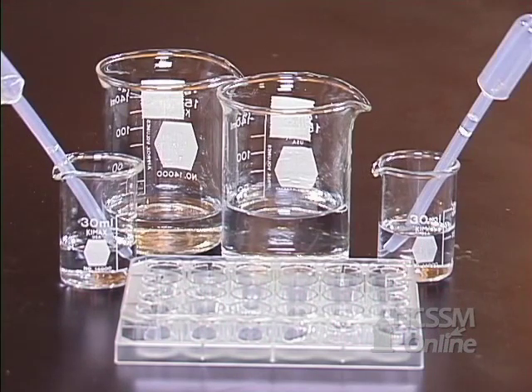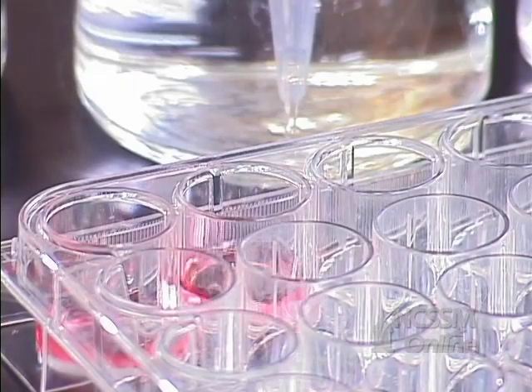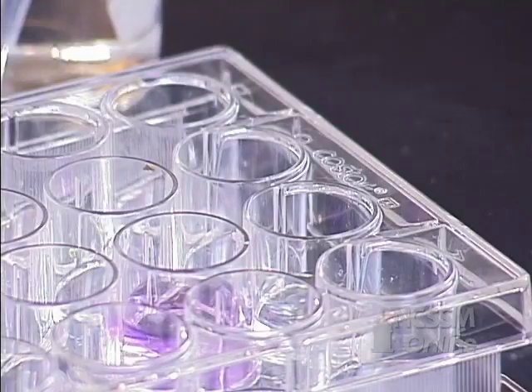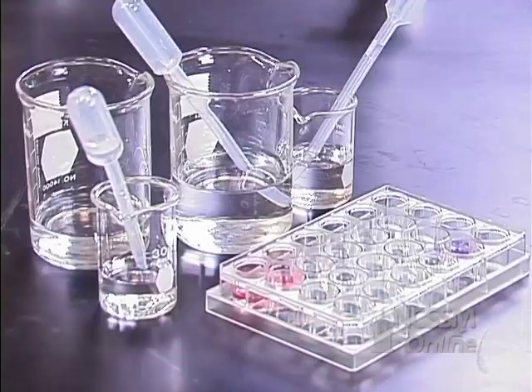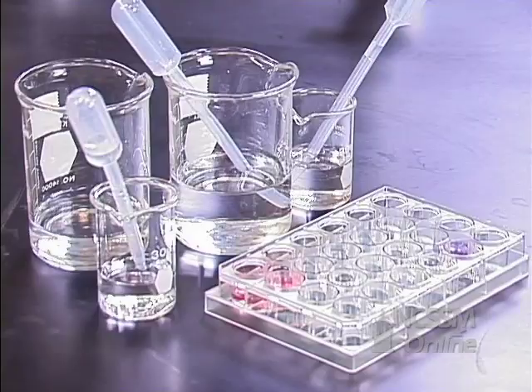When you've made all of your dilutions, add a drop of universal indicator to each of the wells. Swirl them. Compare your solution colors to the color chart provided.